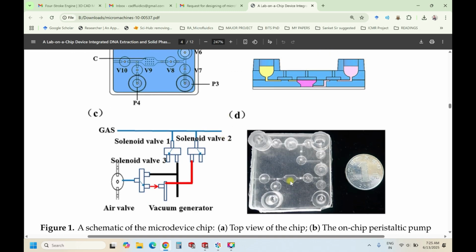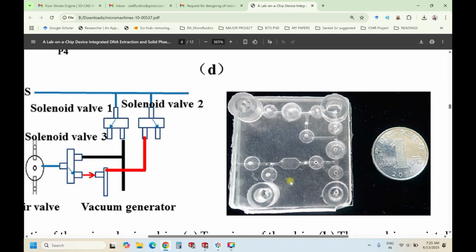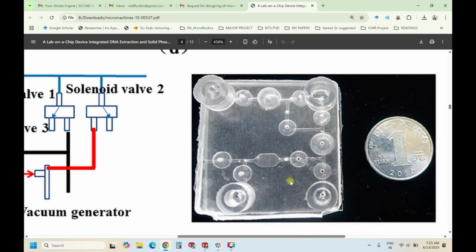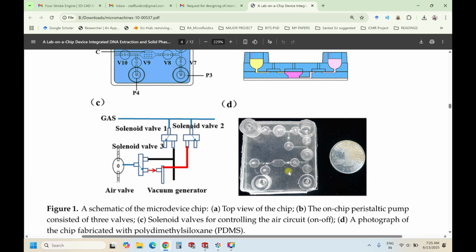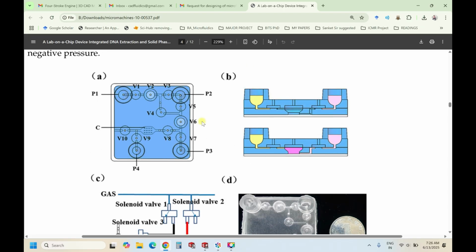So I think explaining it is a little complex in a limited time, but no worries, we can go through the video, the lecture that I am going to deliver now. So this is the final PDMS based device they have prepared. Okay, so let's move ahead, keeping this as a reference.